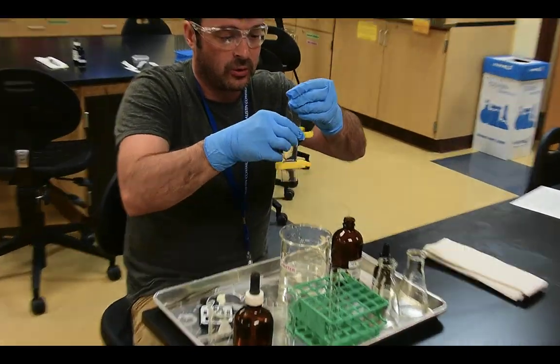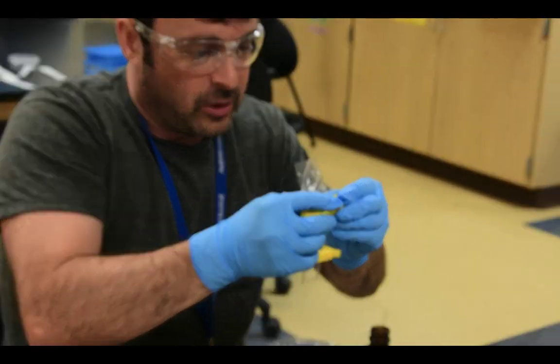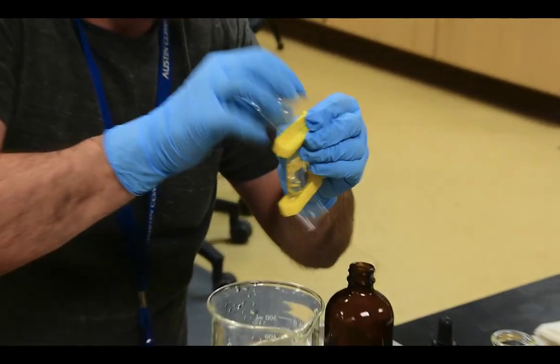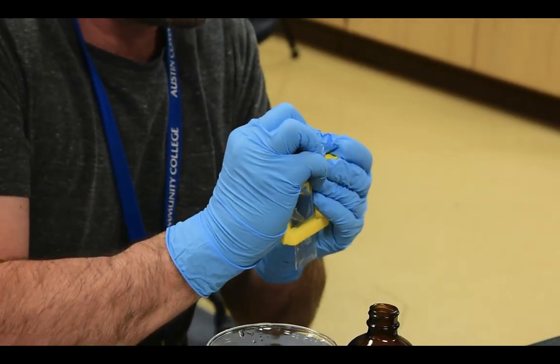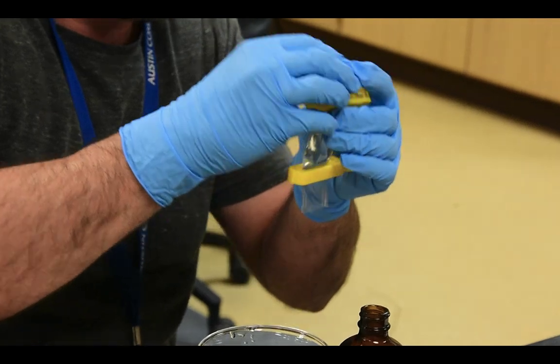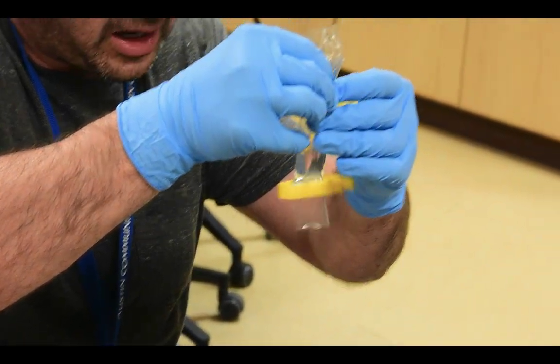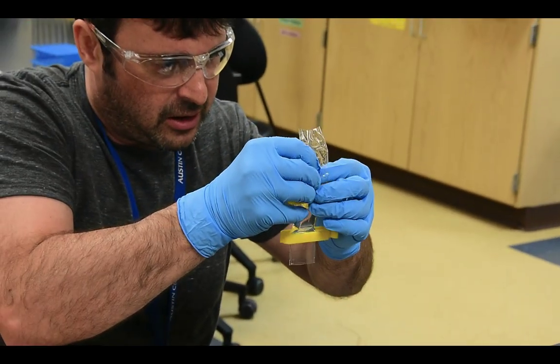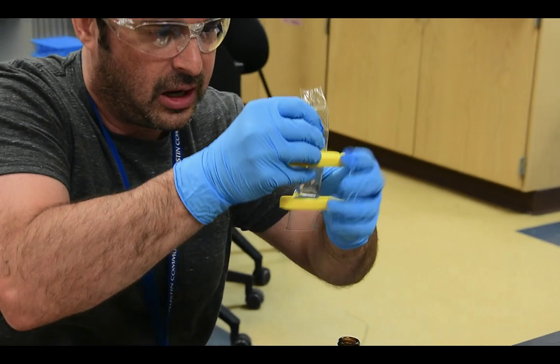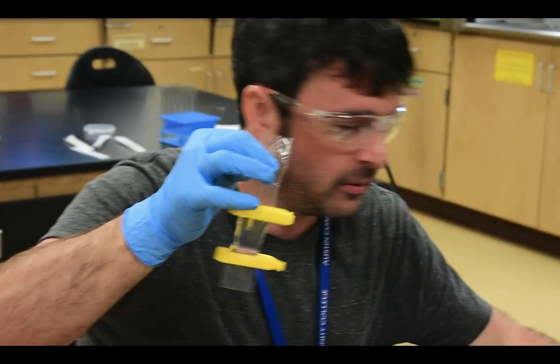Now what we're going to do is clamp off the other end of the artificial cell. Now before doing that, I didn't do that very well, but that's good. It's a learning moment for you. I'm going to try and remove as much air out of there as I possibly can. So I'm going to go back, and I made a little oopsie, and I'm going to try and remove as much air out of that artificial cell as I possibly can. There we go, much better. Not much air in there, we're good.